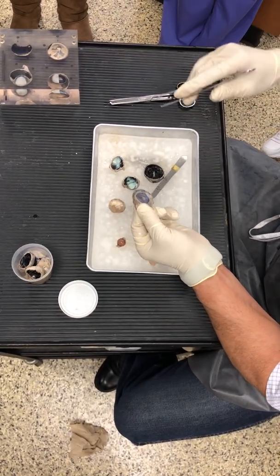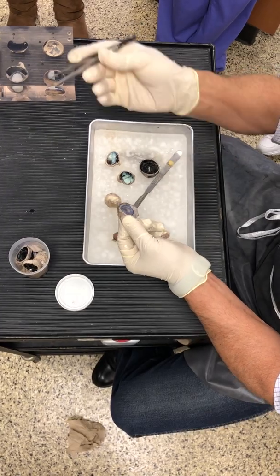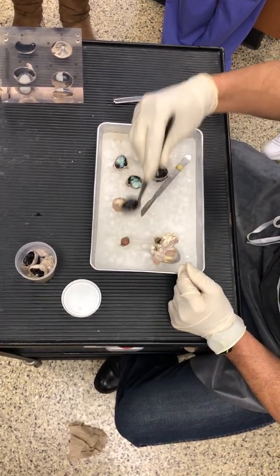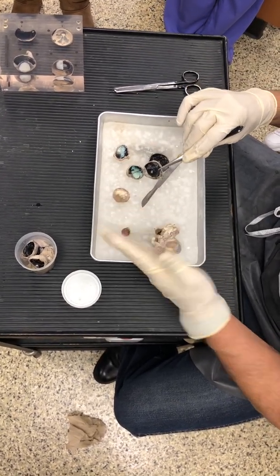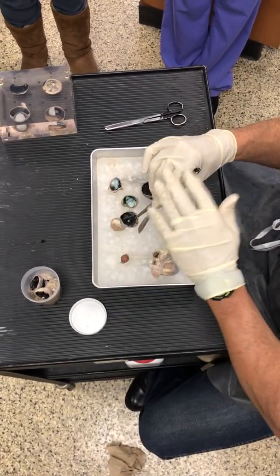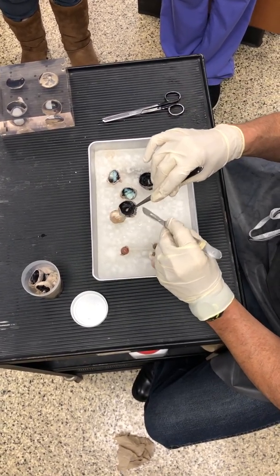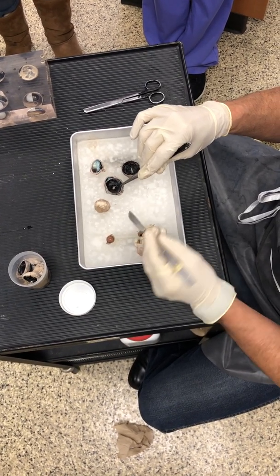If you've got blue or gray eyes, melanin is reflecting to me as shades of blue. What color is melanin? Black. And in my many years of doing this, hopefully we're going to come across an albino eye one day, because a sheep or a person that is albino does not produce melanin, which means what color? It'll be white. It'll be colorless.